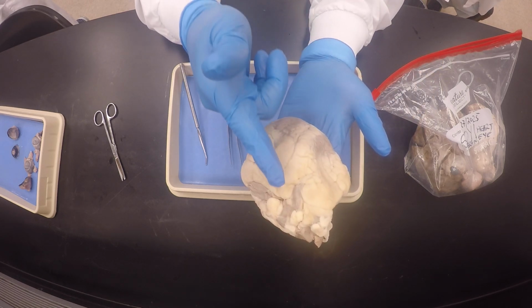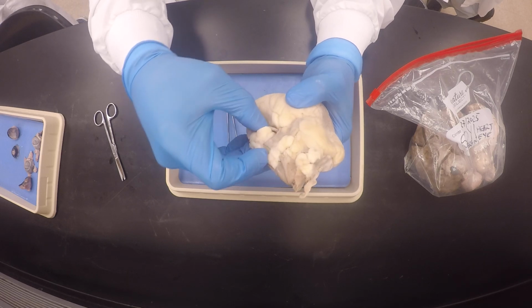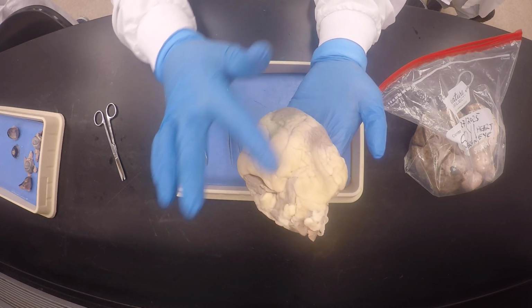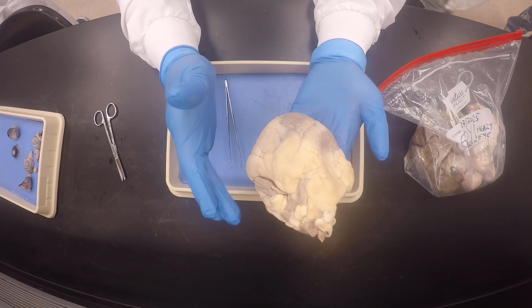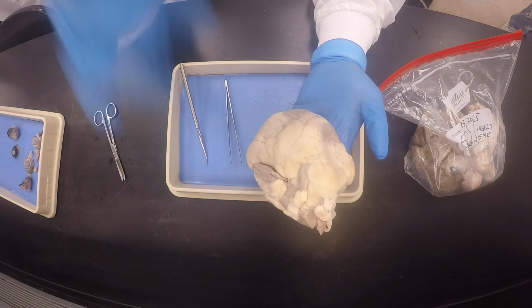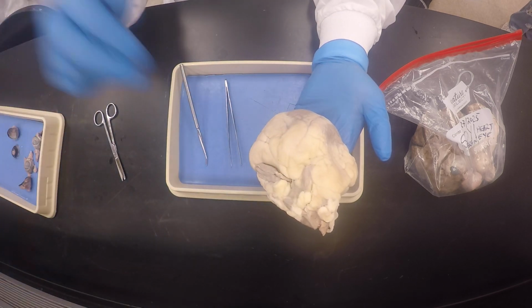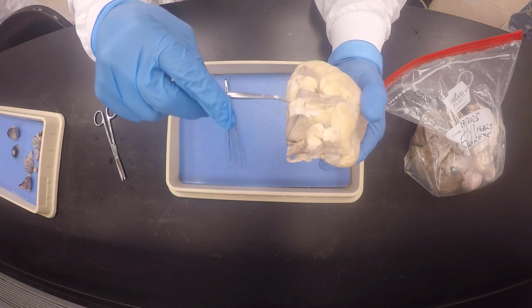Correct? Okay, and this is the anterior interventricular sulcus, and then the coronary sulcus is kind of hidden here. You see what I'm saying? It goes across like that. And remember we said the anterior interventricular sulcus slopes to the bottom right from the top left, and then we will confirm that it is indeed the anterior side, because we see this pulmonary trunk right there. Do you see it right there? It's amazing. You can't miss it a mile away. You know what I'm saying?